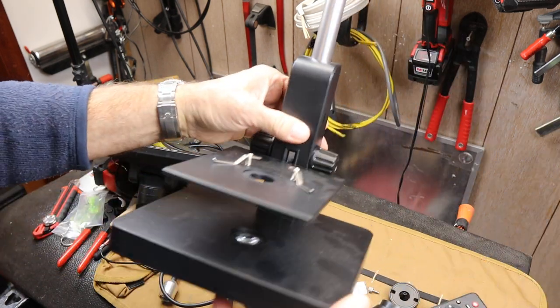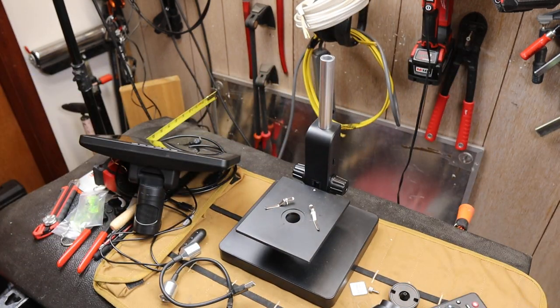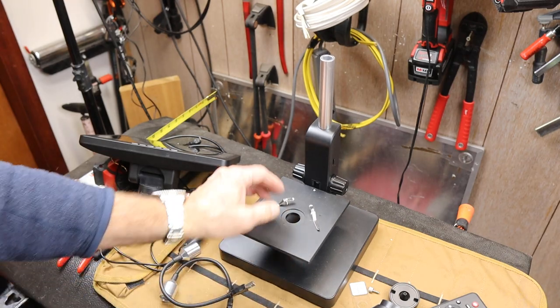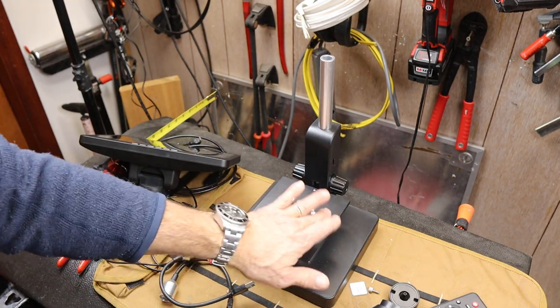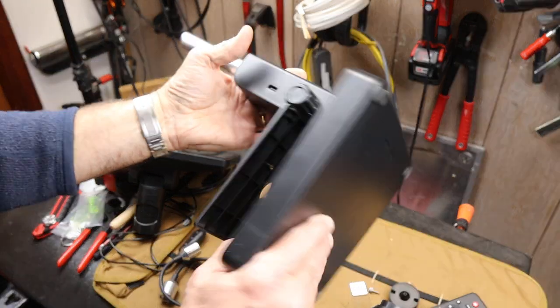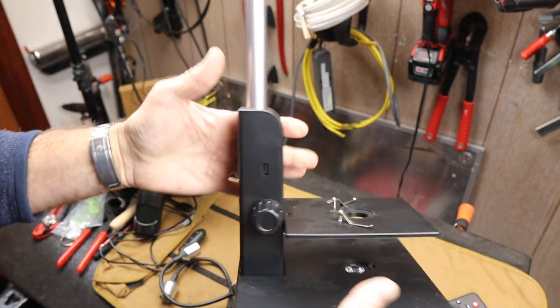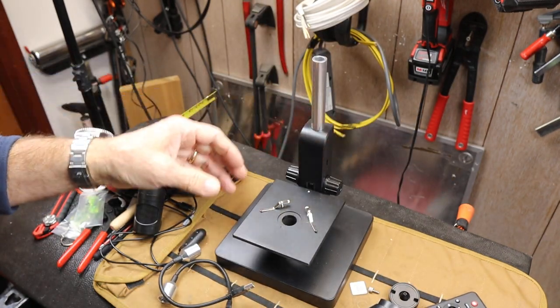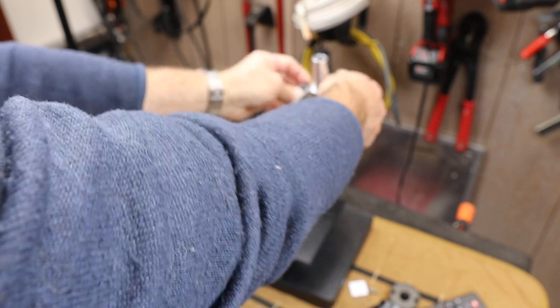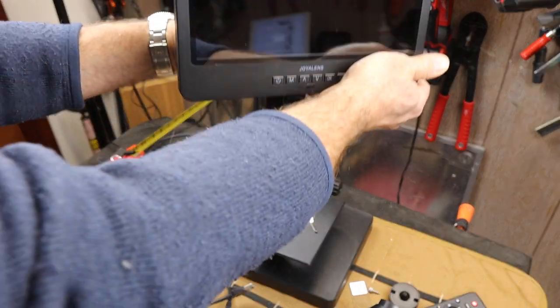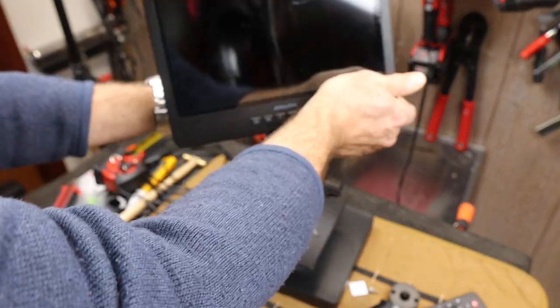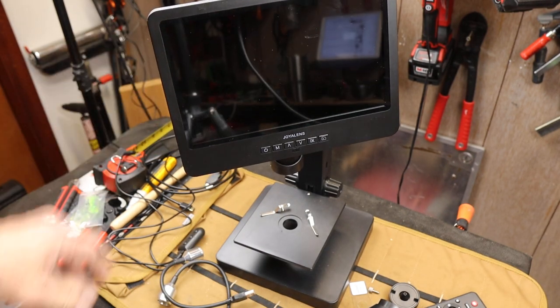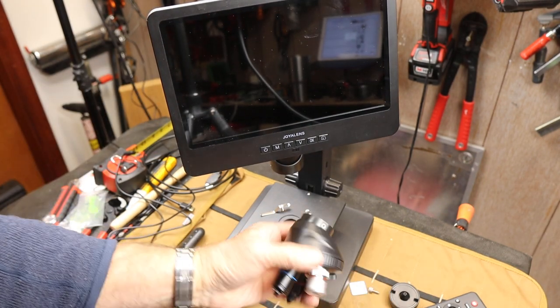I wanted to do an assembly, but I'd have to do it almost in time lapse, just because I'd be flipping the thing around. But that's it. So putting it back together is just as fast. Dropping the camera in. And then plugging the pieces back.